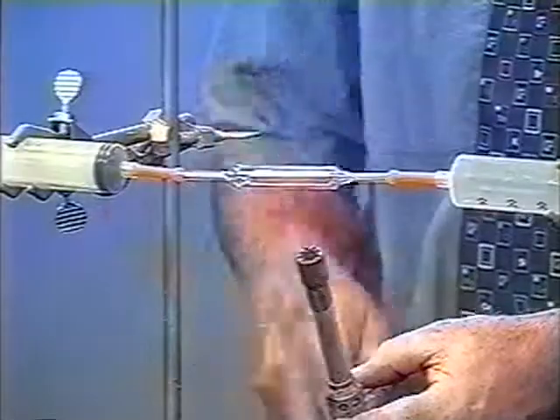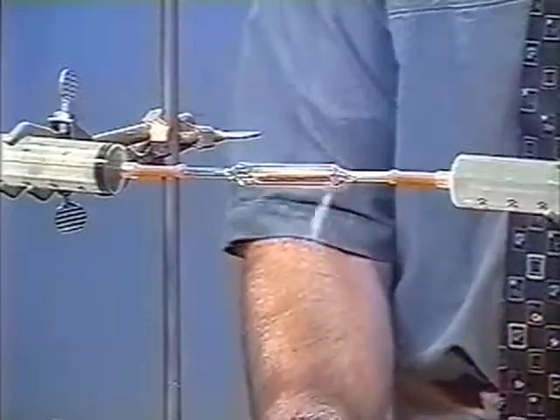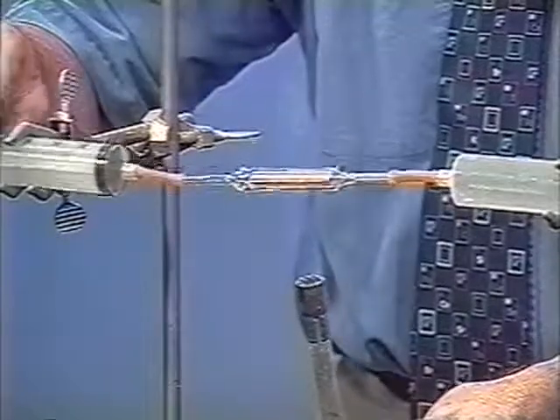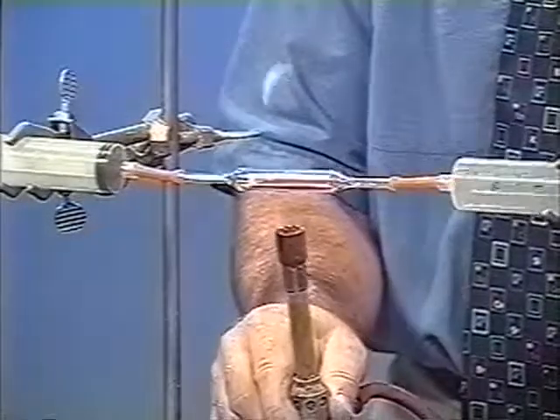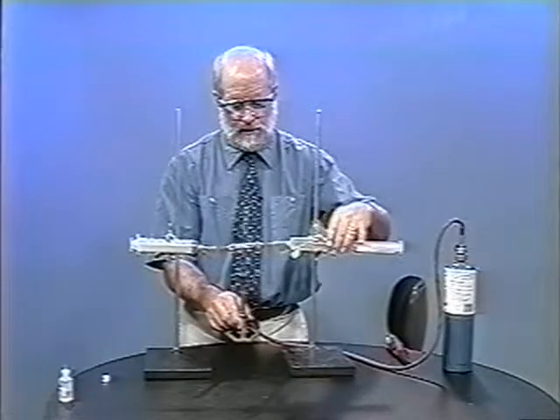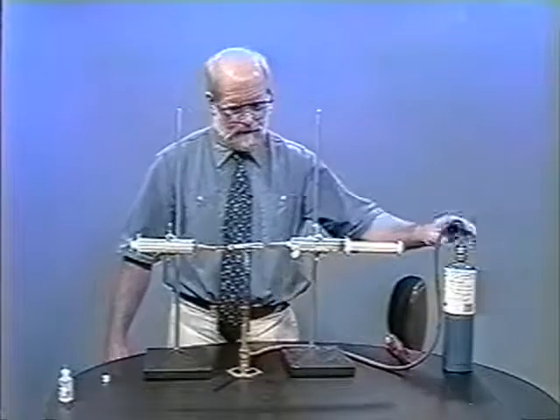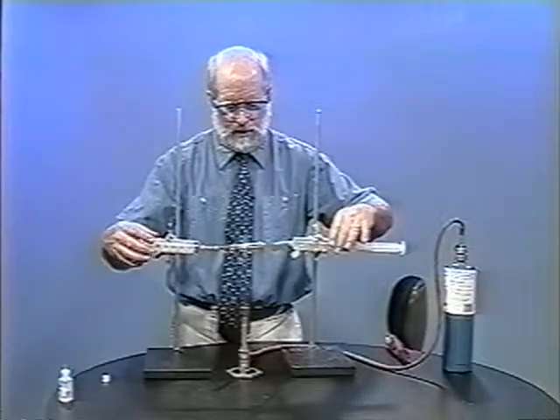It's best if the two syringes are not bound tightly so we can kind of rotate the system. In less than a minute, the catalyst will darken and then we can perform the reaction. This is definitely the kind of experiment that works best with a lab partner. You can see the catalyst starting to darken. At this point, let's just increase the gas a little bit. We don't want any soft spots in the glass, so we can't heat it too much.